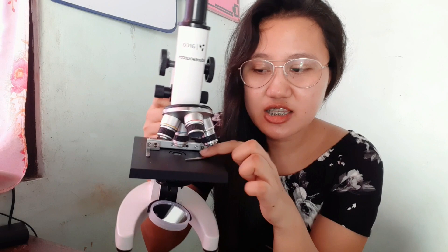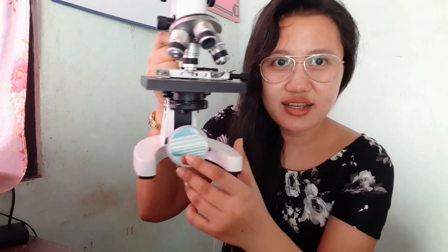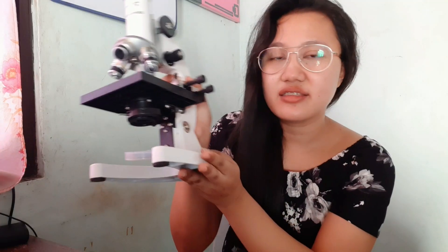Let's review the parts of our microscope. We have the eyepiece, the body tube, the revolving nose piece, the coarse adjustment knob, the fine adjustment knob, the stage, the stage clip, the mirror, the diaphragm, the base, and the arm. Very good!